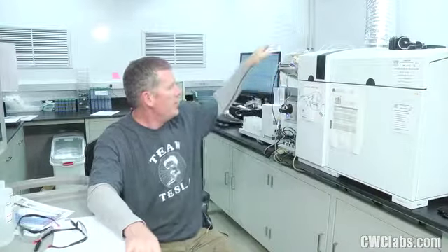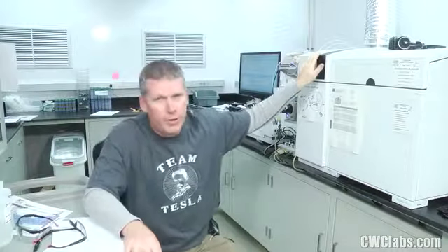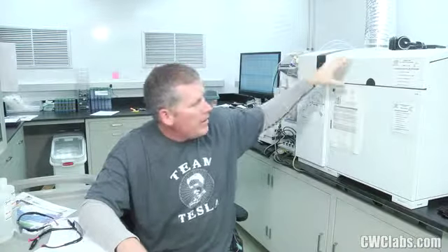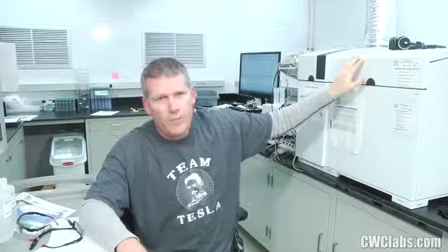Remember that everything that you're introducing in the system is not only going onto your cones, but it's also going through the octopole, and it's going through the detector, all that. The vacuum chamber of this whole unit, you're going to extend the life of all of that, including the PMT, if you reduce the concentration of material that you're putting on that system. It's going to last longer. It's going to be happier. You're going to reduce consumables, all of that. So those are my tips for today.